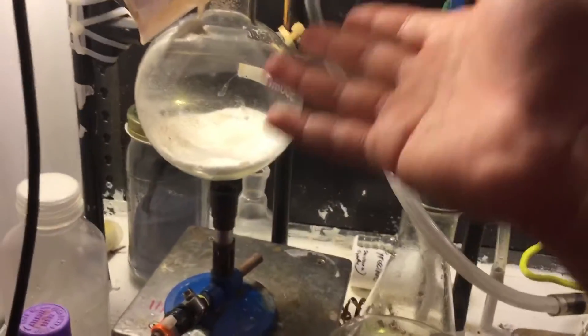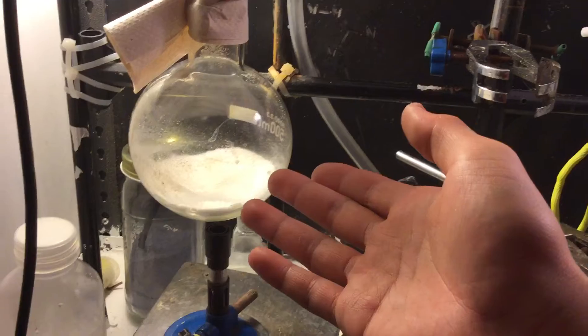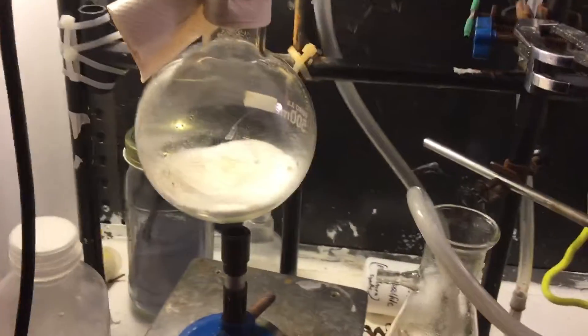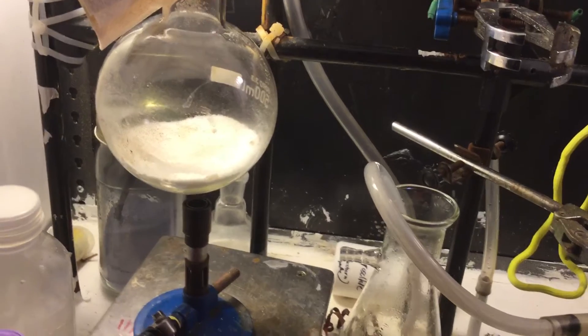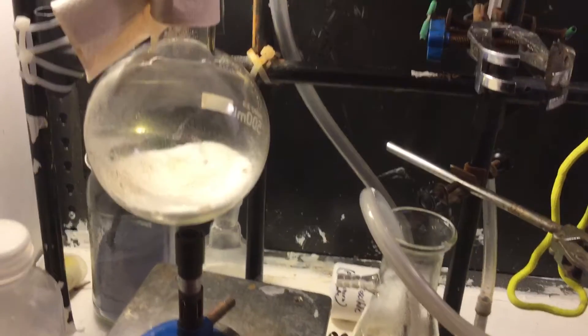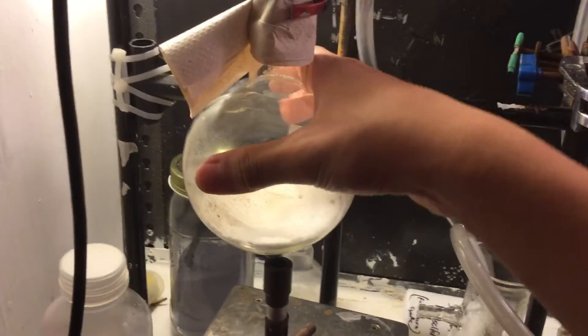And it did fume, but that's just hydrogen chloride. So I don't know how we're gonna continue. We're probably gonna have to get phosphorus pentoxide, what's the deal with pentoxide? It's expensive.